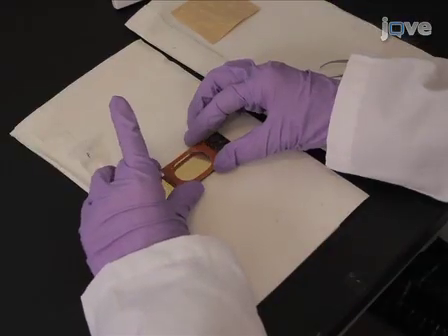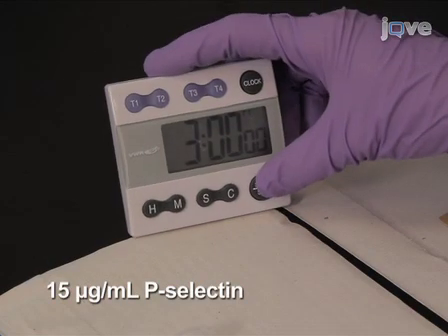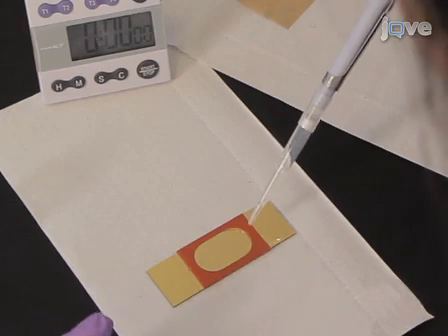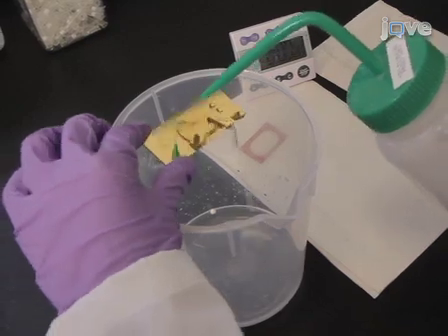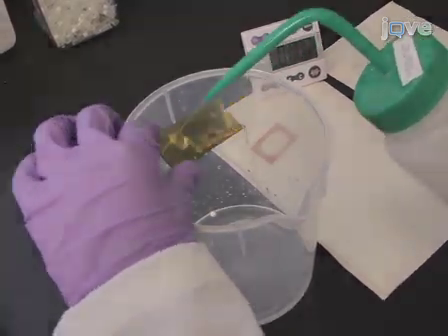Now, using a perfusion chamber, incubate the substrates with 15 micrograms per milliliter p-selectin solution for 3 hours at room temperature to pattern the remaining areas with p-selectin. Rinse the chamber. Then backfill the surfaces with 1 mg per milliliter BSA for 1 hour to block non-specific interactions. Rinse the surface with DPBS buffer before performing the cell rolling experiment.